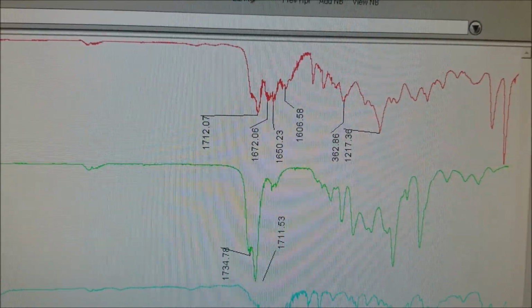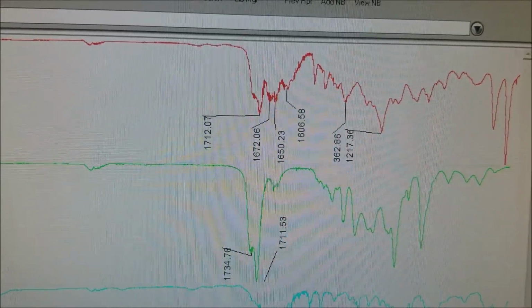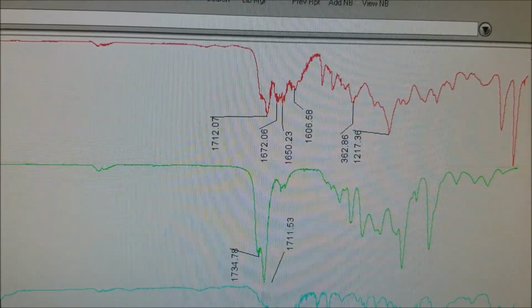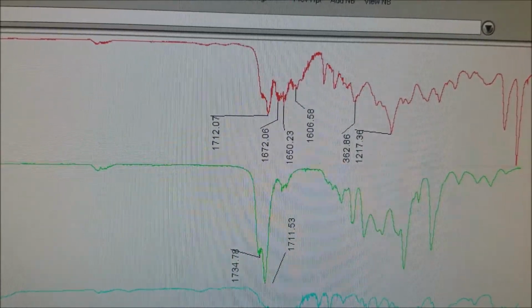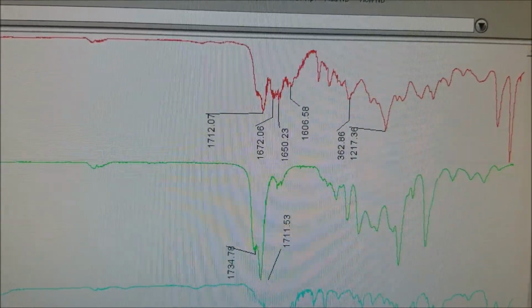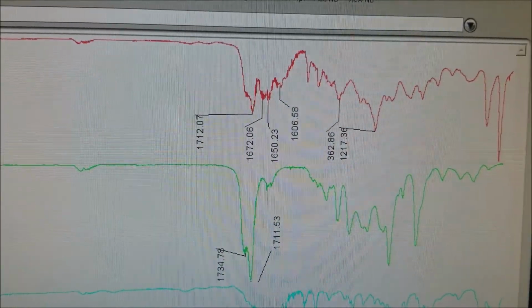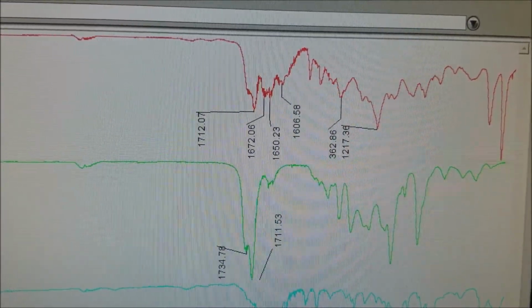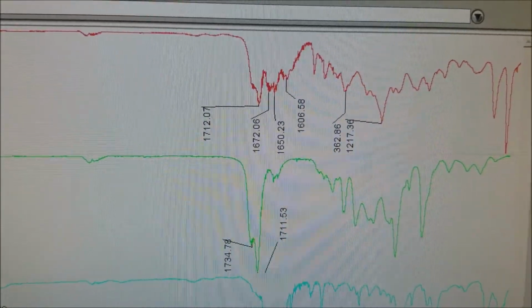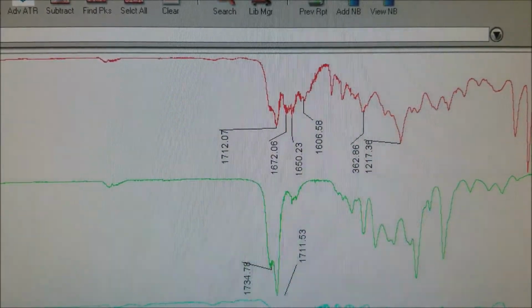And we still see the phenyl peak at 1606, and we see some other alkene peaks at 1672 and 1650. In addition, we should expect at least a pretty strong CO peak as part of the ester between the 1300 and 1000 region. And I think those at 1362 and 1217 are probably associated with that.